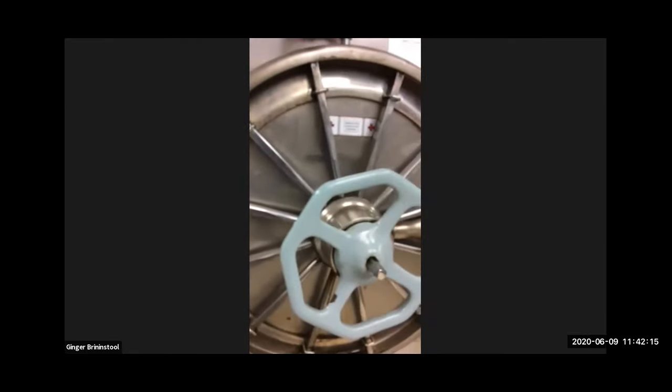So this is the handle, and it takes 2 hands to undo it. It is quite strong. I am not weak. So you've got to give it a good tug. When you do, you should step back as you open it because steam will start to rise. You may or may not be able to see, but there's steam rising. So it was hot in there, right? And granted, it's only at 42 degrees Celsius right now. It was at one point quite hot. So you should always be careful.